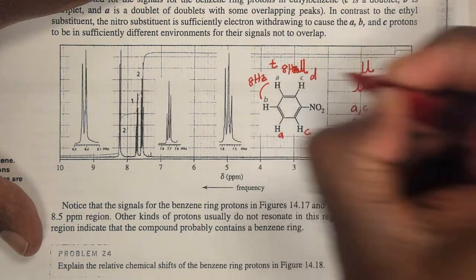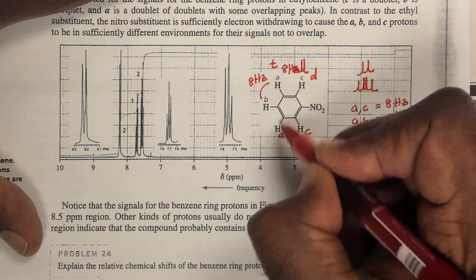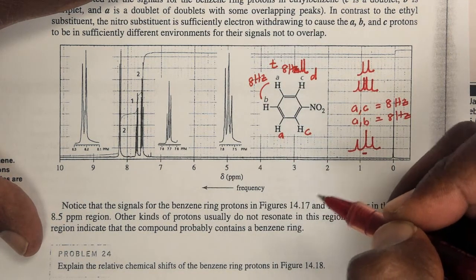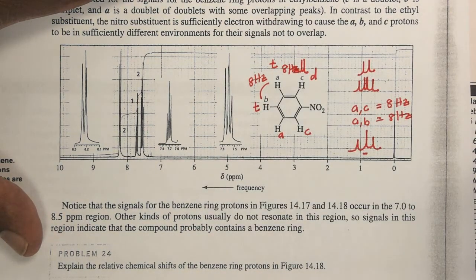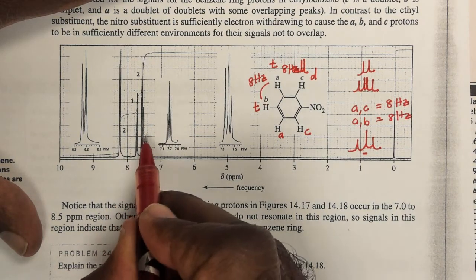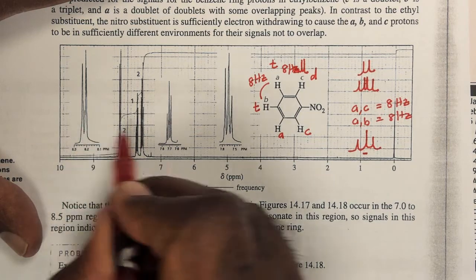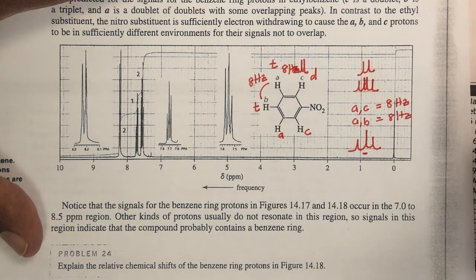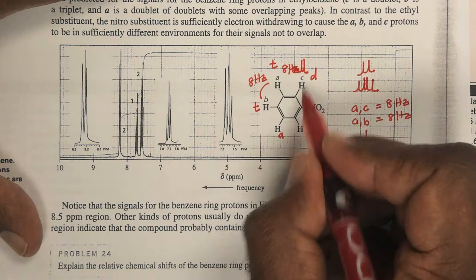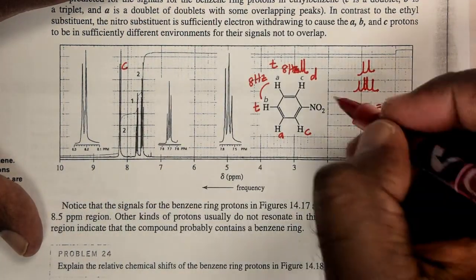C we know would give us a doublet, right? And B you find is next to these two equivalent protons, so B would be a triplet. Right, so this would be a triplet. And if I look at my spectrum, I see a doublet and two triplets. Right, so this doublet is expanded here, so you can see that this is clearly a doublet. And these two are triplets, they're expanded here, so you can see they're clearly two triplets. Right, so at this point in time, I would be able to differentiate C from the other two. So my doublet must be C.